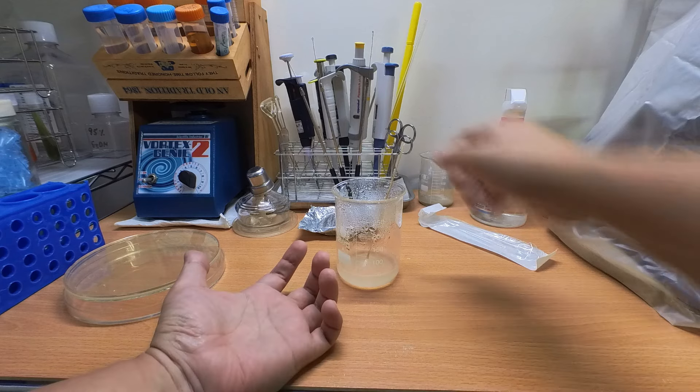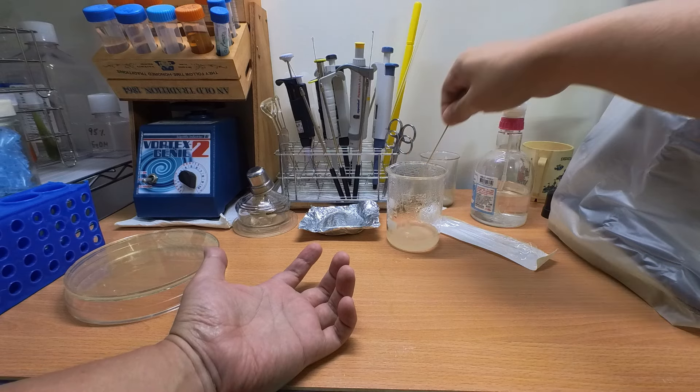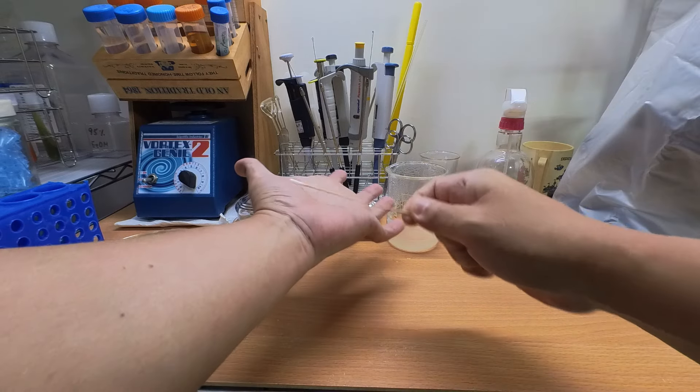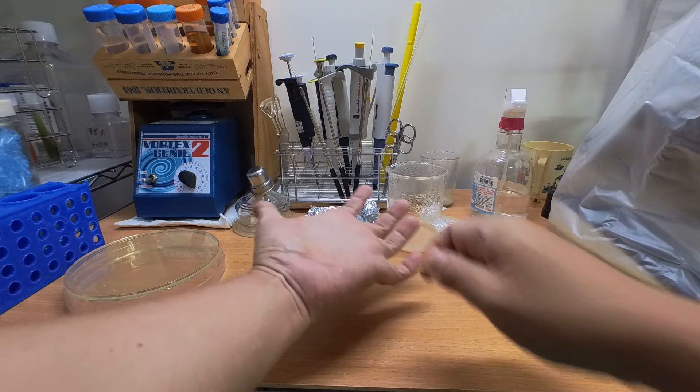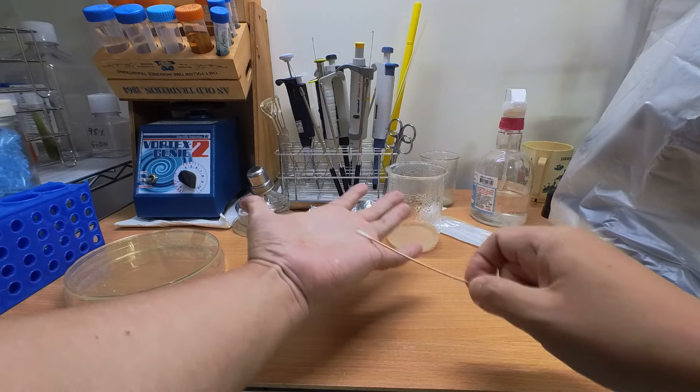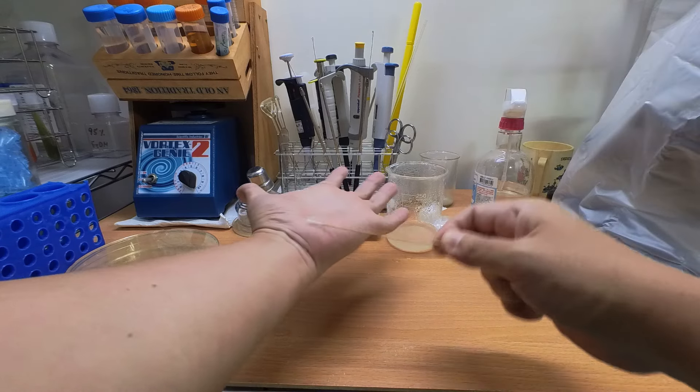What I plan to do is to put something on my hand and wash it with different washing methods with soap to see if I can get my hand clean. And at first I'm thinking about using the bacteria that I just used in the test.